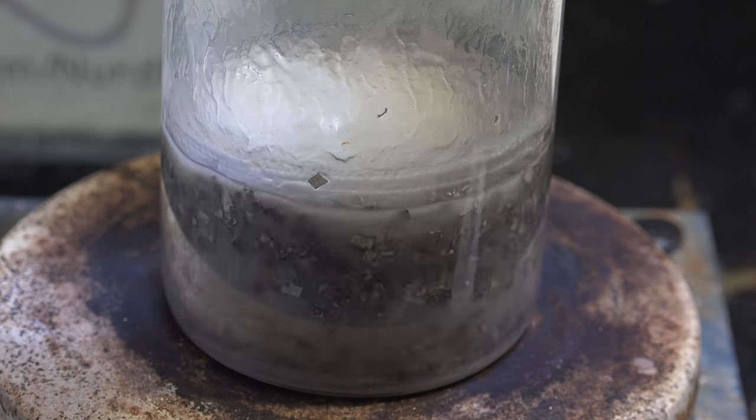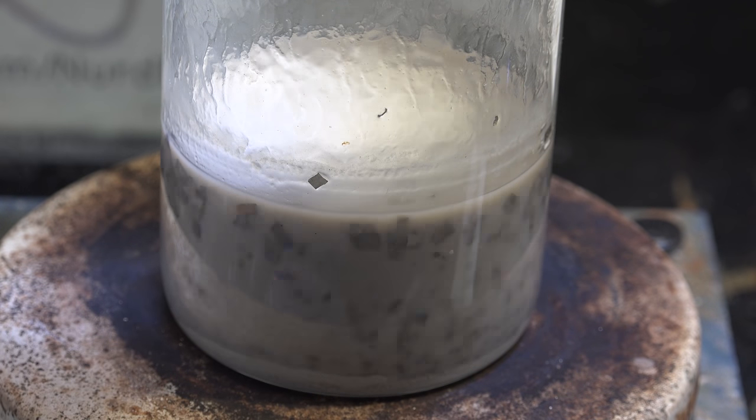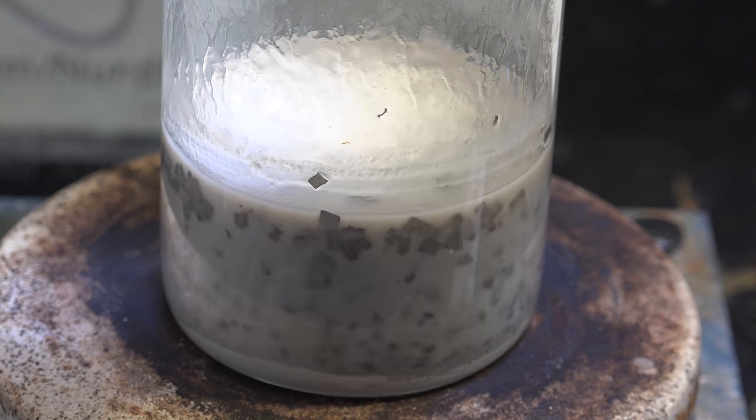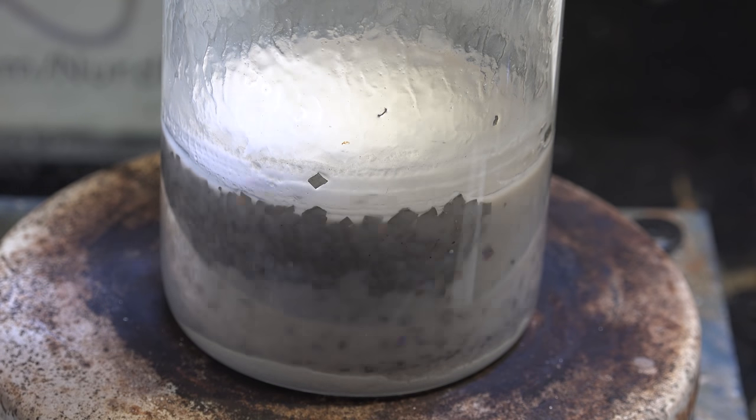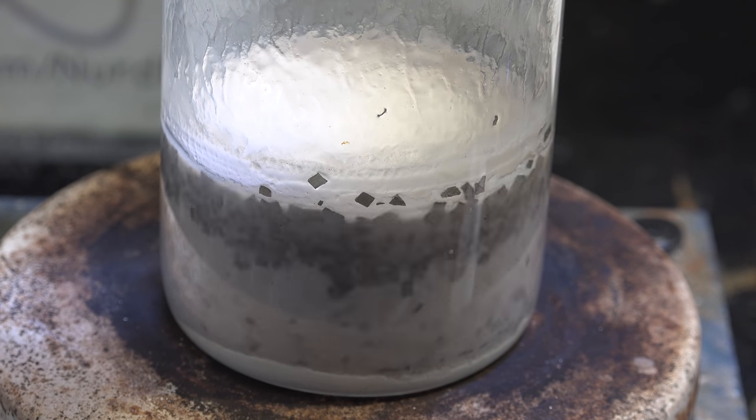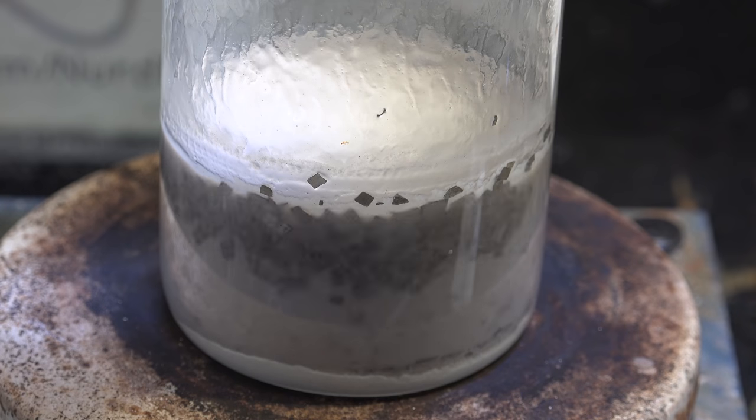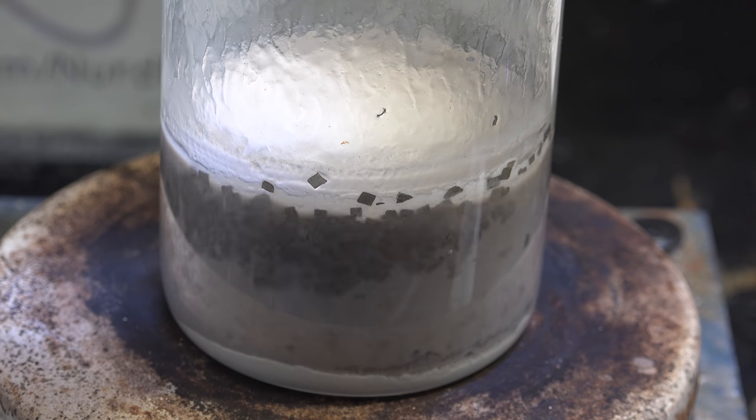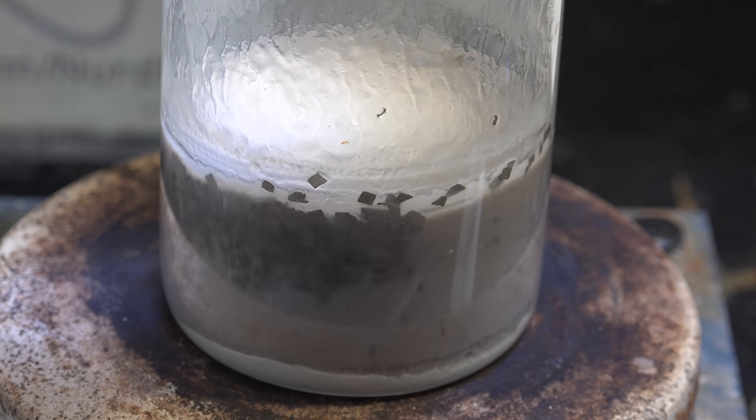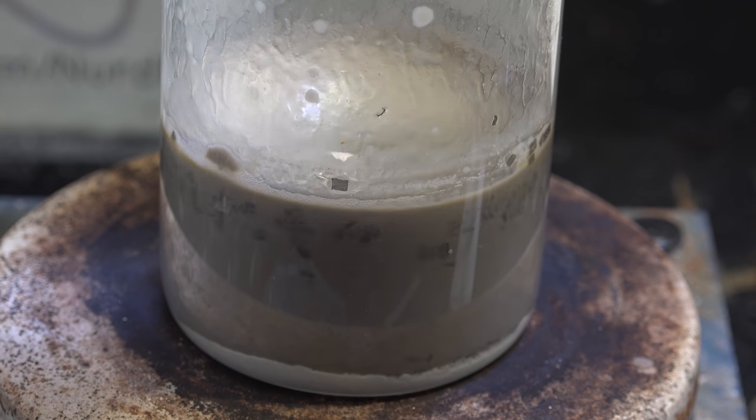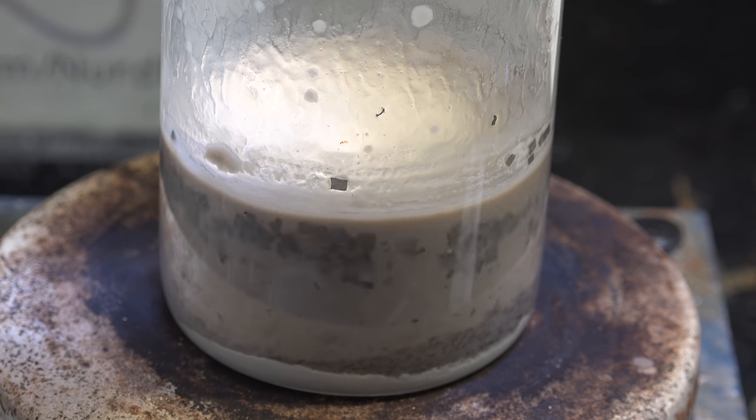But this doesn't mean it can't work. Maybe making sodium in a mason jar would be viable since they're designed to let gas out but not back in. However, I'm not going to try this yet because I don't trust a soda lime glass mason jar to handle the extreme thermal stresses the reaction produces as well as genuine borosilicate glass labware.